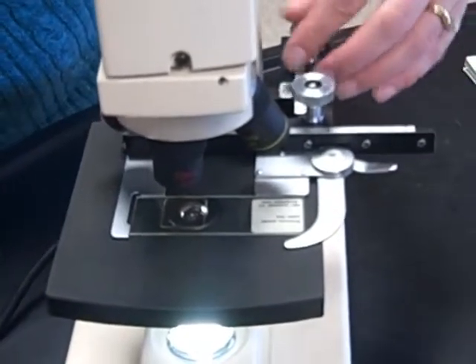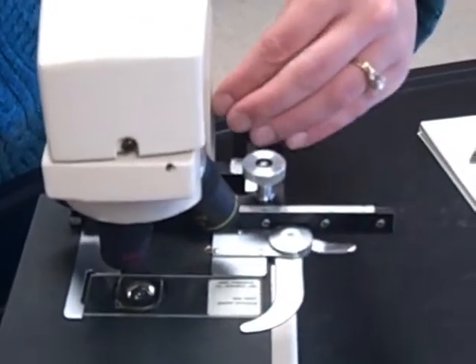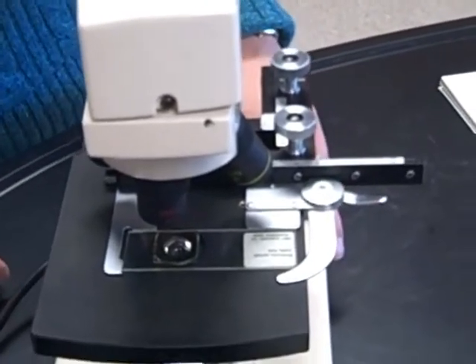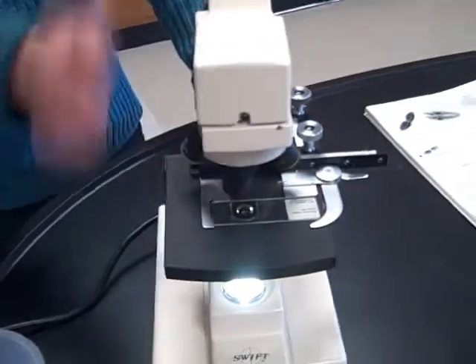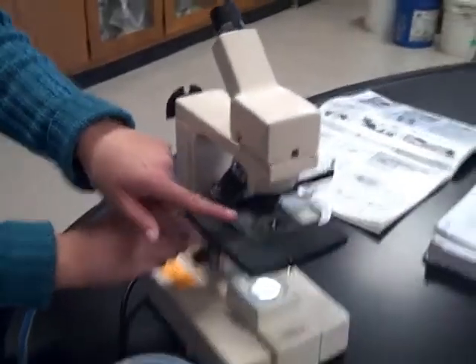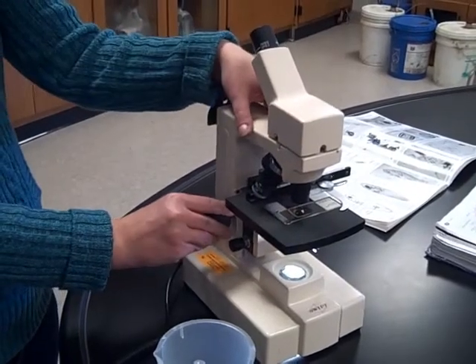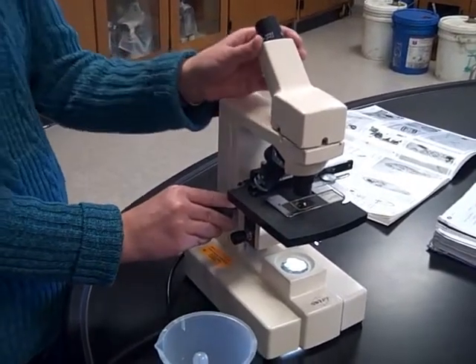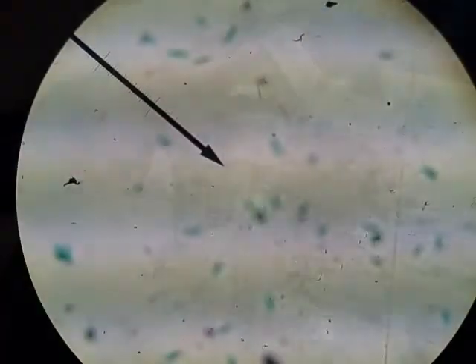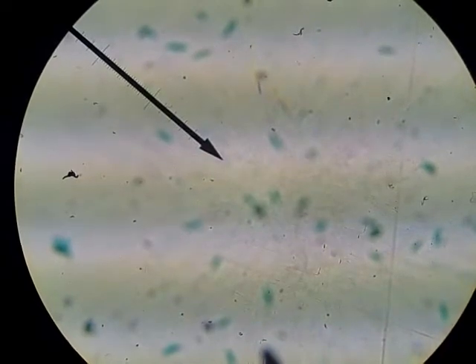Then you'll want to center up your slide. Let's go ahead and turn our microscope on and begin to focus our image. You'll want to always start with your stage as close to the objective as possible. Let's go ahead and take a look through here and see our image. We can see some kind of green specs here — we're on our lowest power.